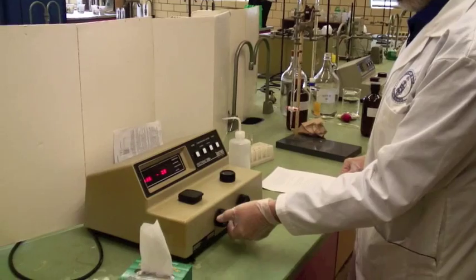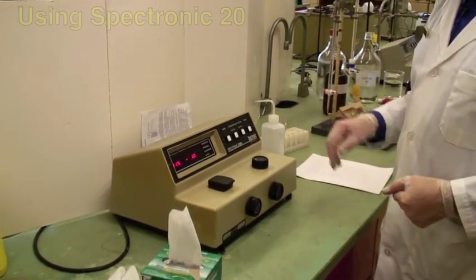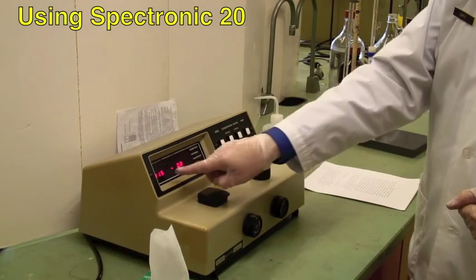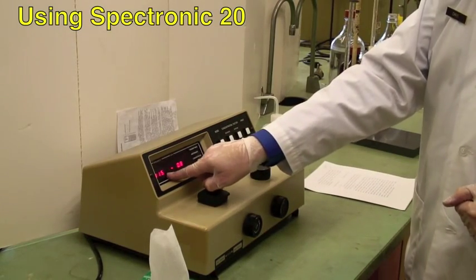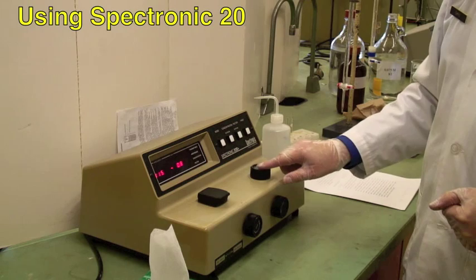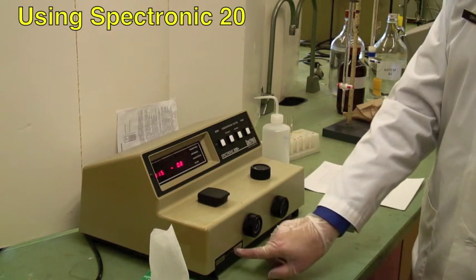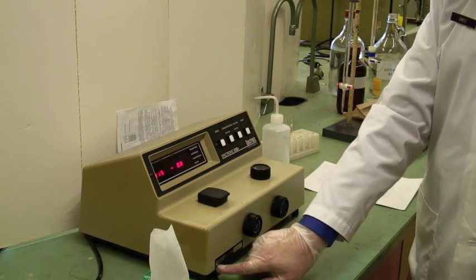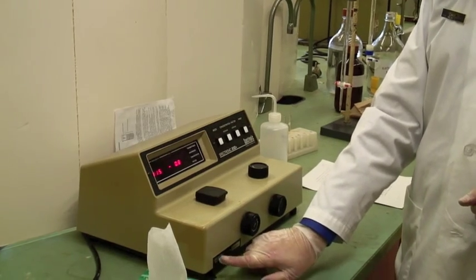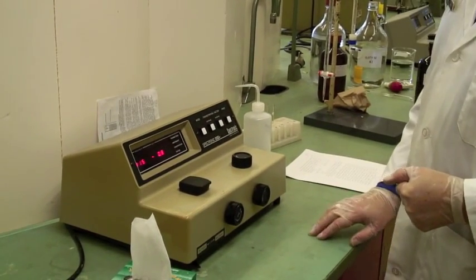We'll turn it on first of all, and we're monitoring this at 415 nanometers. It's actually set at 415, but if you need to change it, this is the knob that you use. Make sure the filter is in the right place — it's for 340 to 599 nanometers — so again, this has been preset.